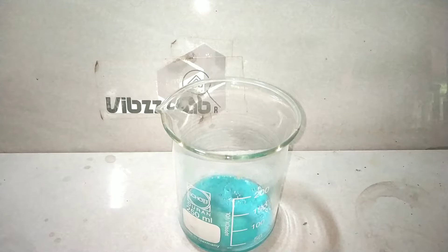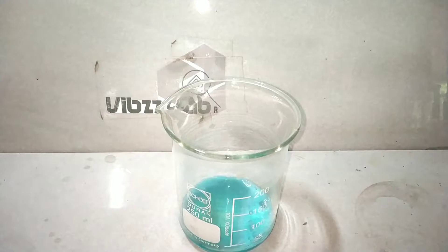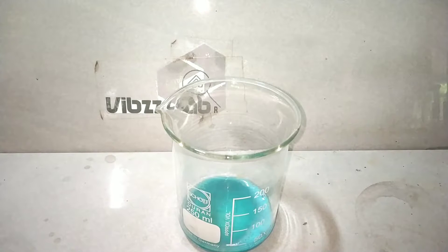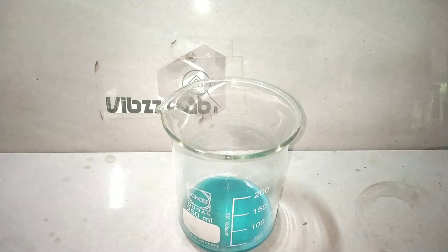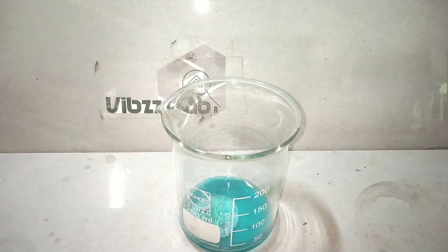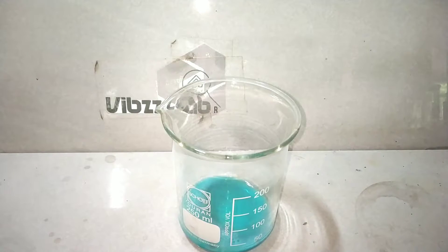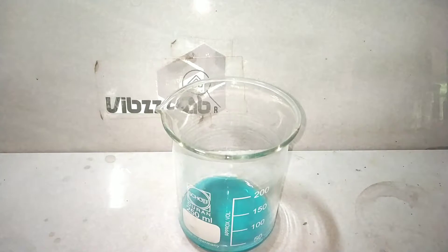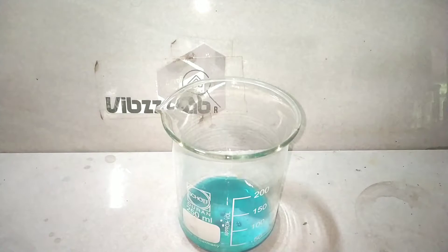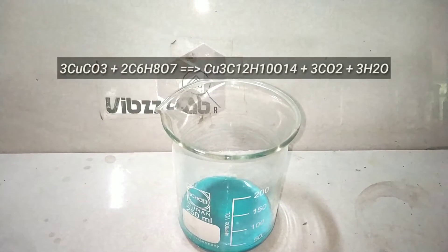You can clearly make out the fizzing when I add each scoop of copper 2 carbonate. What is happening is copper 2 carbonate is reacting with the citric acid to produce copper 2 citrate, and carbon dioxide gas is being released as that fizzing.